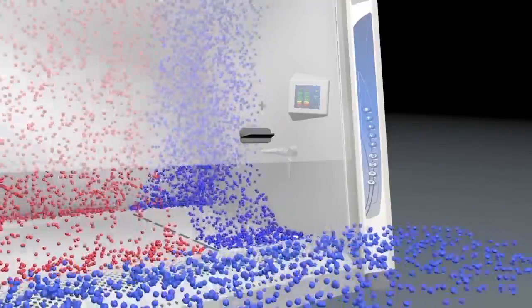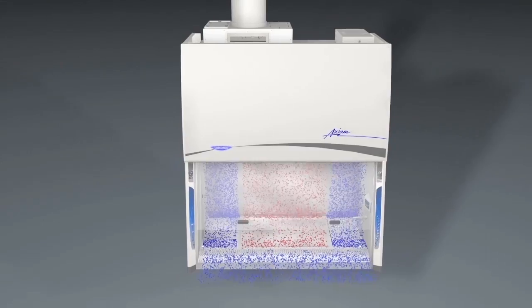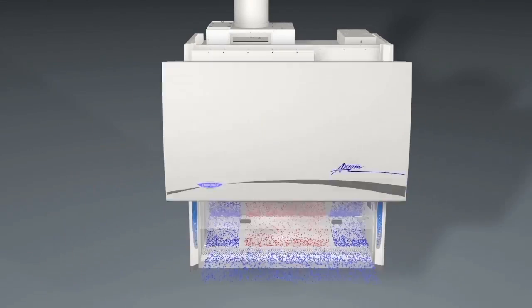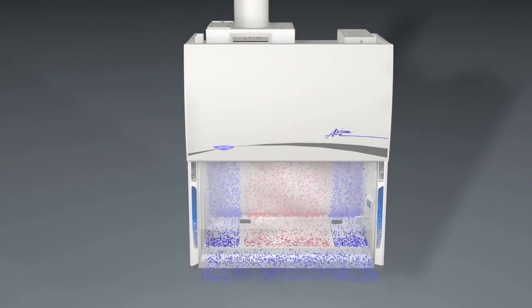Lastly, have your certifier validate the cabinet's airflow, HEPA filter, and alarm operations.